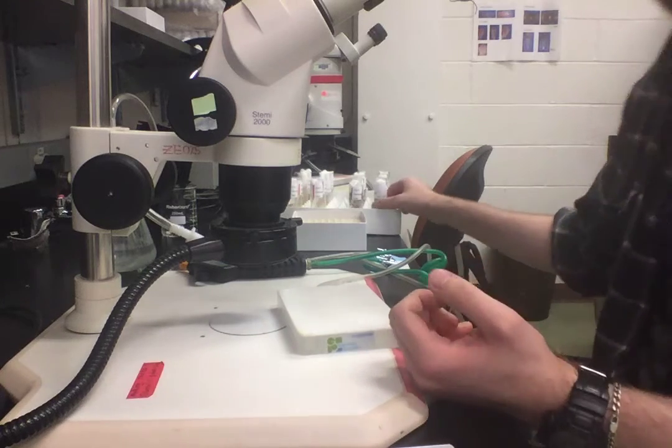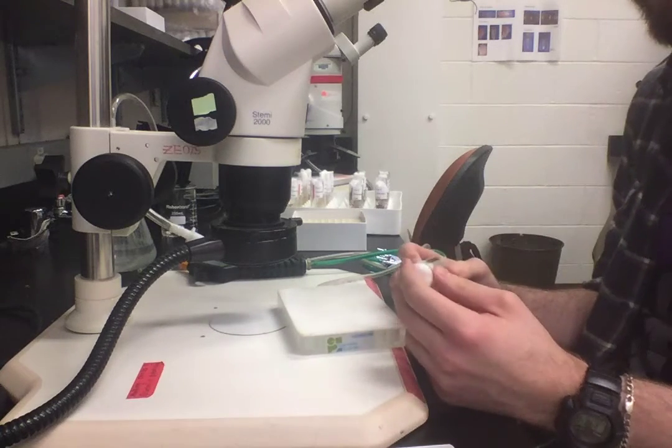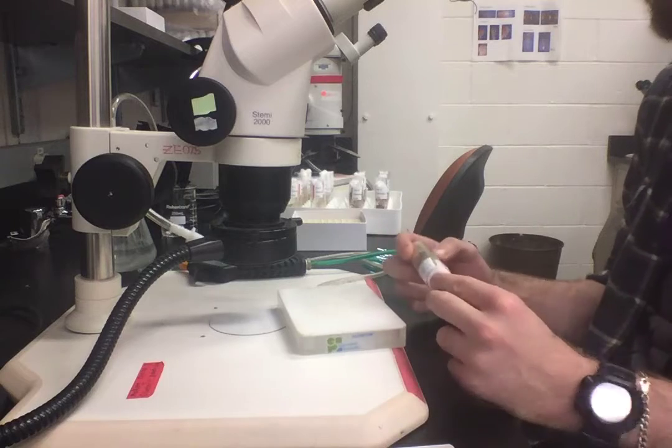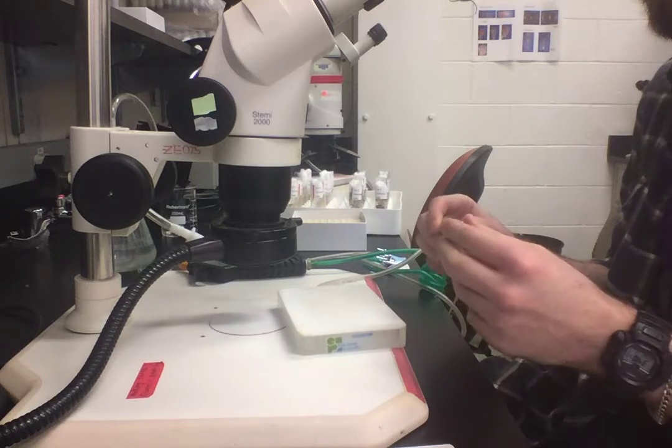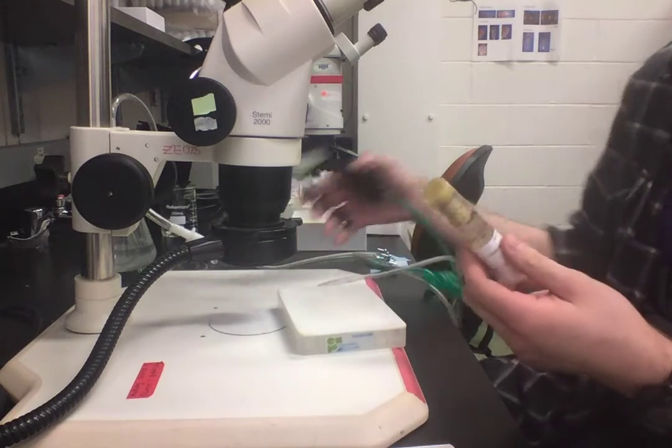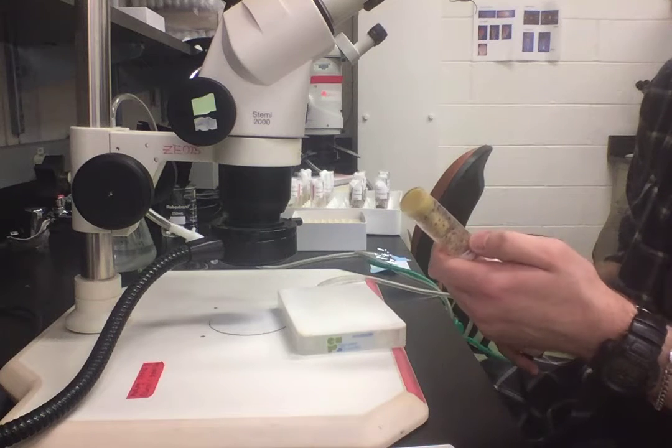I actually had to freeze some flies today, so I figured I would make a video showing how to do it. It's not difficult, so I'll just do a quick demonstration of how to freeze flies.